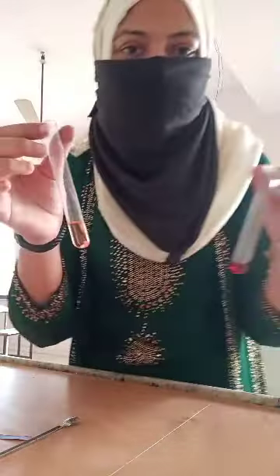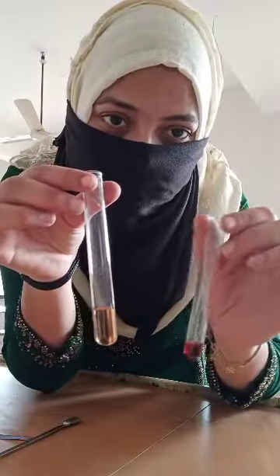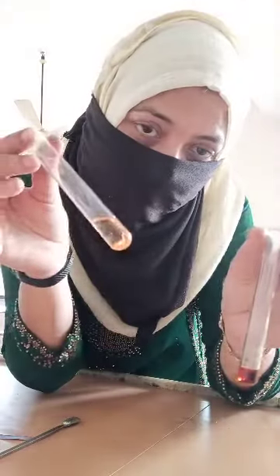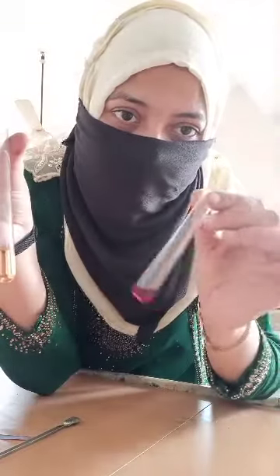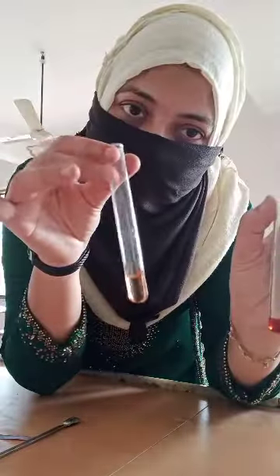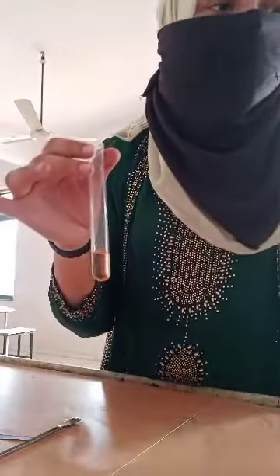Something I want you to notice: I have taken the phenol from different bottles. One is coming with a dark red color and one is coming with this lighter color. In the live lecture, I showed you with this one. In your video, I am showing you with this particular one. I hope that is clear. So let us begin.